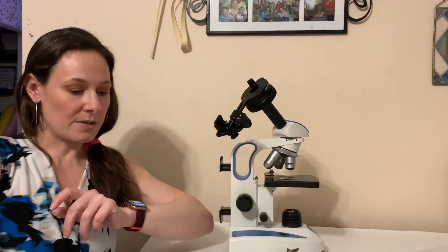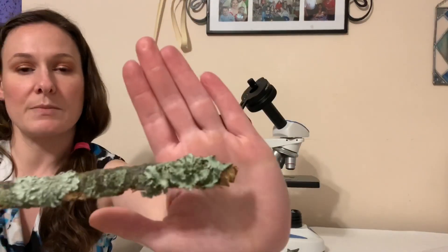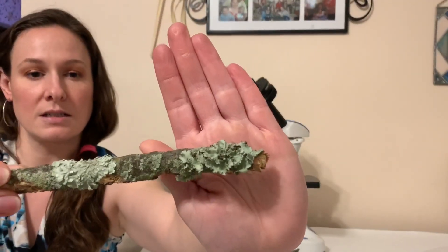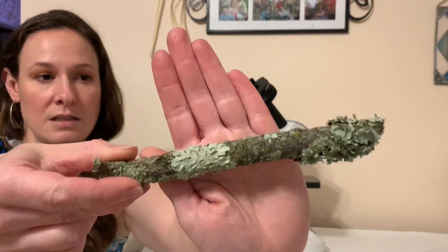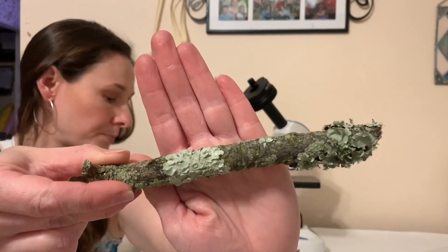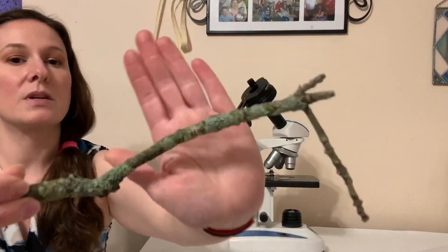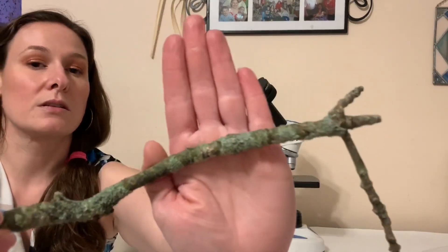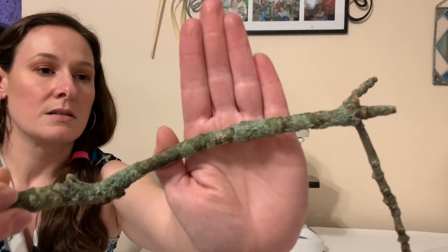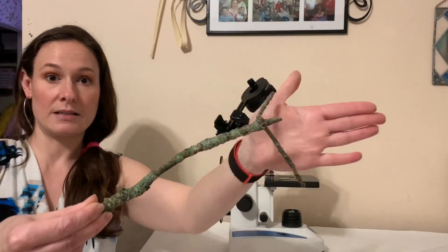We also have this beautiful sample of lichen, and we have another sample of lichen where the lichen looks a little different — on this nice stick Danny found.